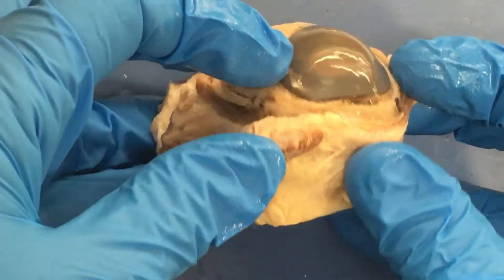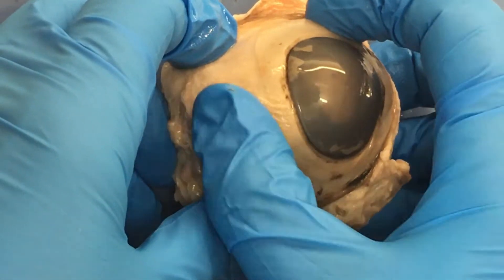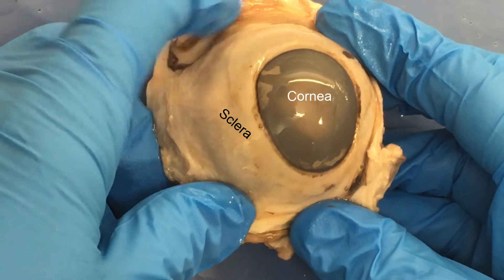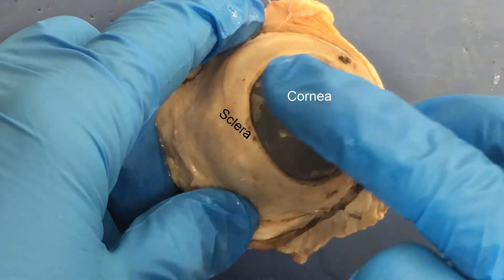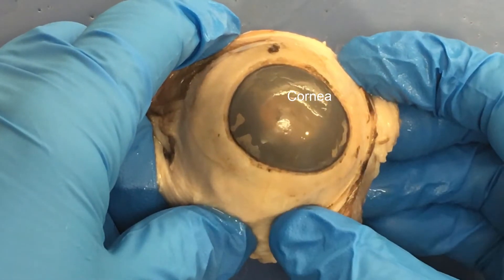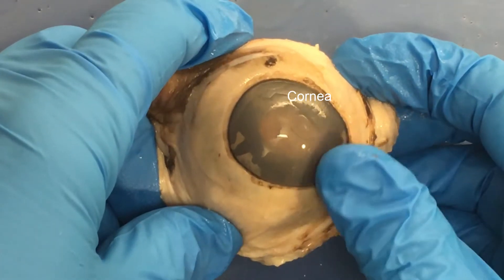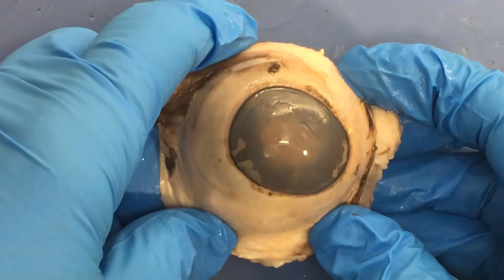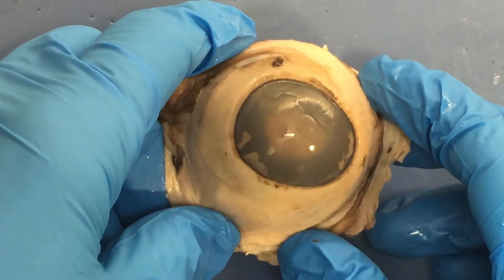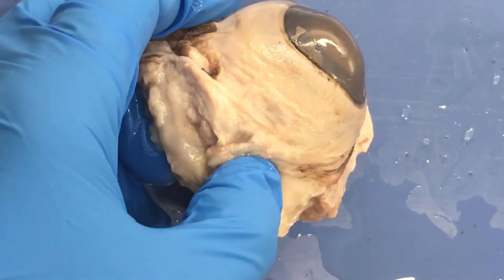There's a bit of fat and muscle, but then you can see the obvious wall of the eyeball — that's called the sclera. And then this part here is the cornea. The cornea and sclera layers are actually continuous with each other. I'll talk about how you can have a transparent layer like that in lecture. And that's really all you can see right now.